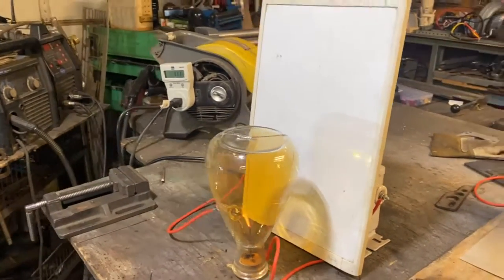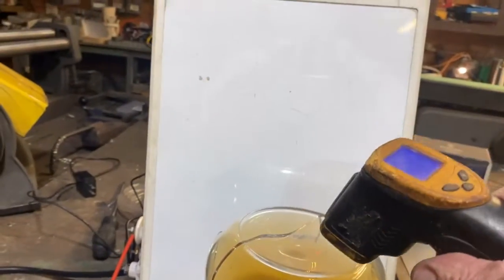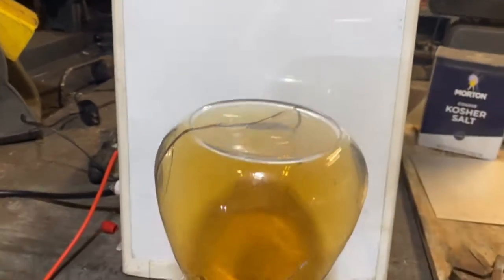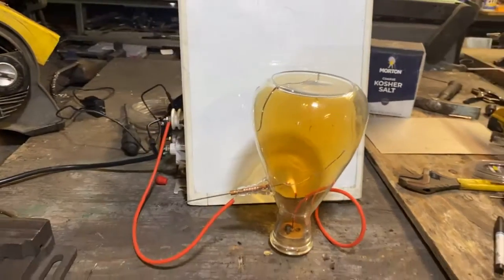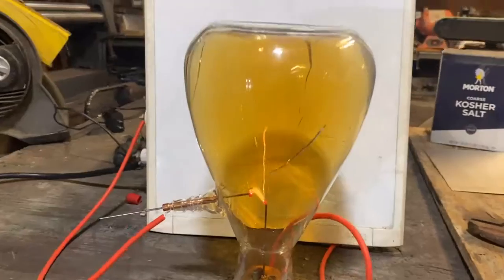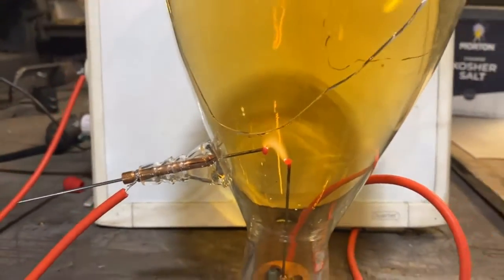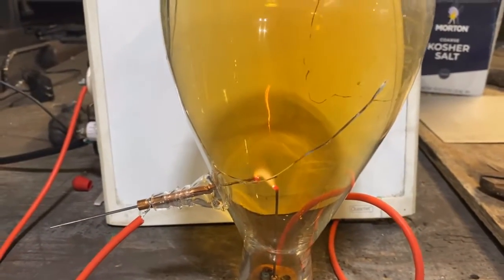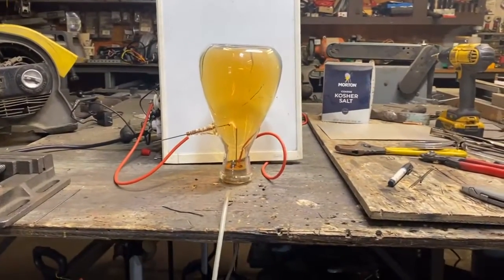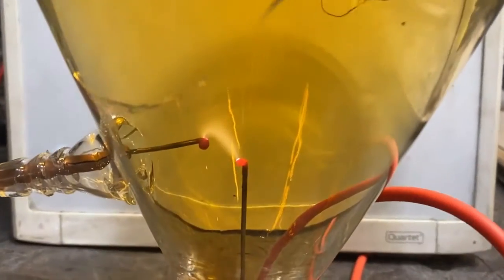I guess I'll have to cool this thing. Nonetheless, this is the electrode we're going to go with — I don't even have to have this in a glass reactor really. That's unfortunate, I just lost that piece of glass simply because it wasn't annealed for a while. But even though it's broke, I think this one beats them all — it looks darker than all the rest. Red hot stainless steel electrodes are the way to go.